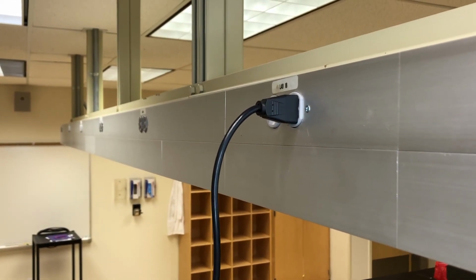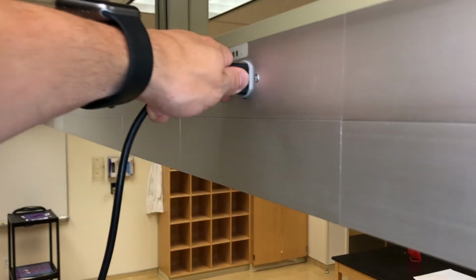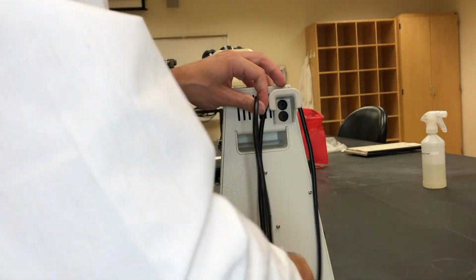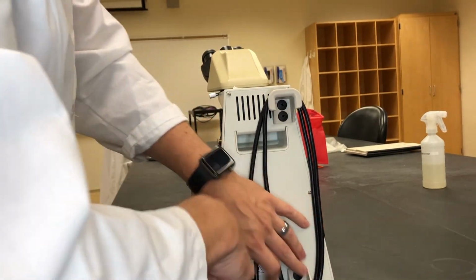Alright, you guys made it through the introduction to the microscope video. When we're done with our microscopes, we will unplug them and we'll wrap them up for storage. Make sure we put our cover on it too when we're done.